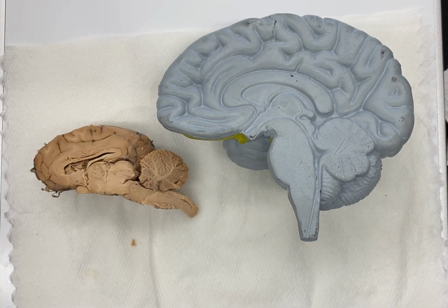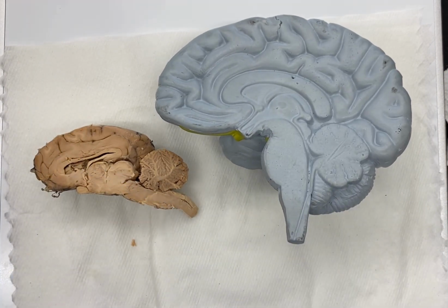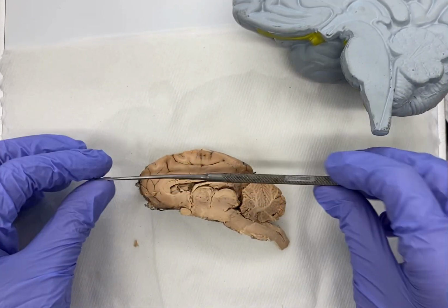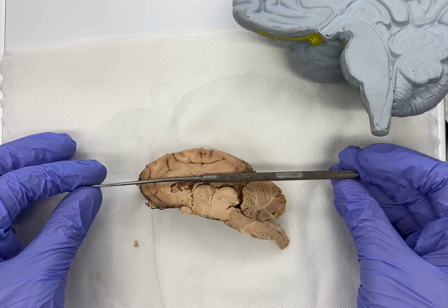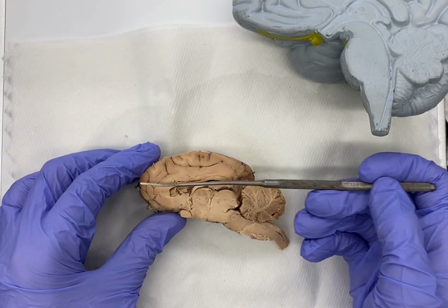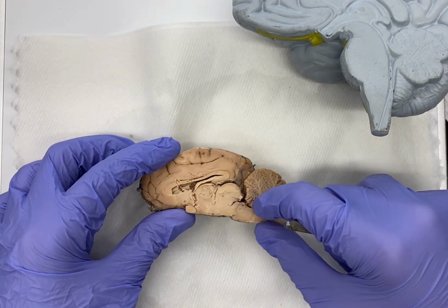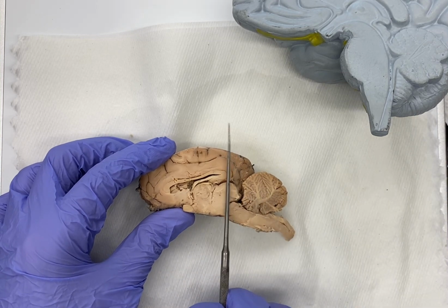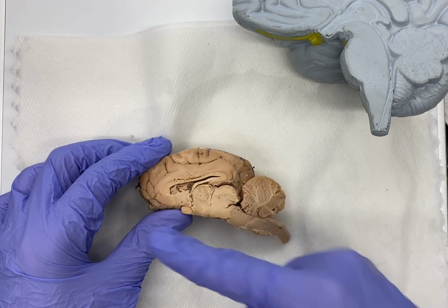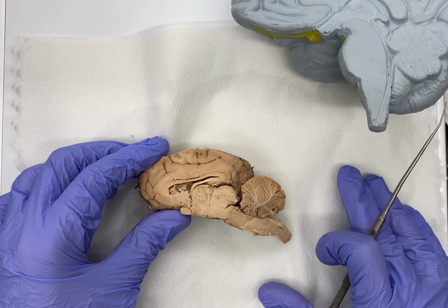So we'll first look at the sheep brain. You'll notice here's the lengthwise orientation of our sheep brain. It's mostly oriented like this, and then the brainstem and the spinal cord are running largely in the same direction, so it's more parallel to the orientation of the brain. It's coming out the back. Here's our midbrain, here's our pons, our medulla, and our spinal cord. It's roughly running in that horizontal plane, and it goes out the back of the skull.